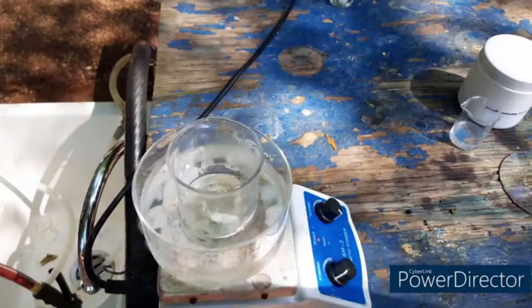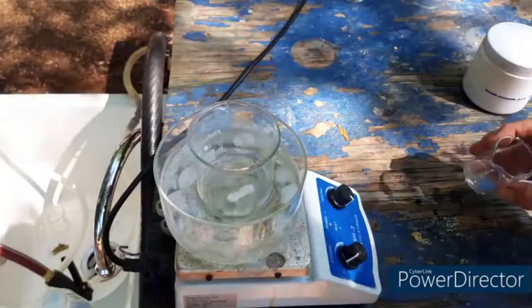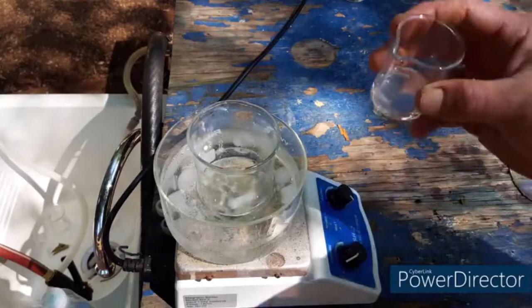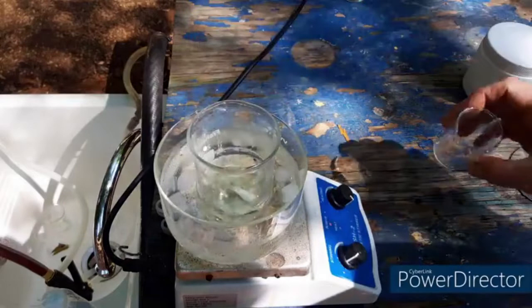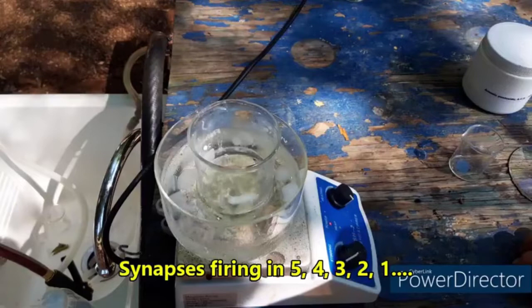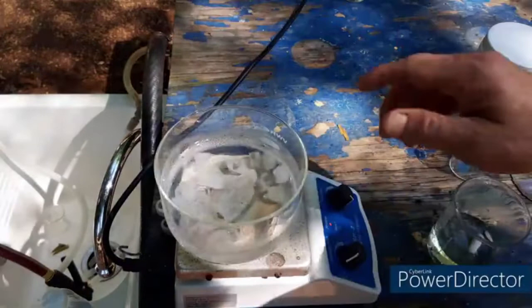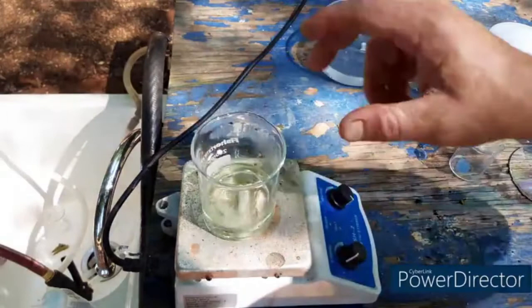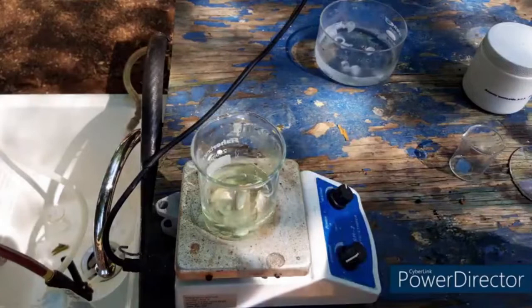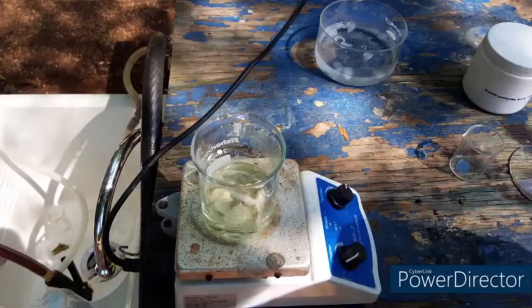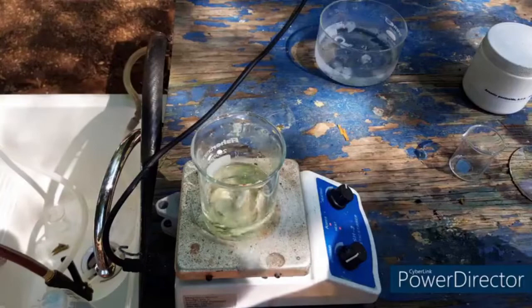Let's make sure we can get the color change that's supposed to happen here. So now we have to add our arsenic acid to this, and we should get a yellow compound. Wait, that's right, I forgot, can't forget the other part of the protocol. You have got to heat it up now. The protocol says to heat it up to 60 to 70 degrees Celsius. Now I am going to let that happen, and then I will come back when we hopefully have a nice beautiful yellow solution and or compound.